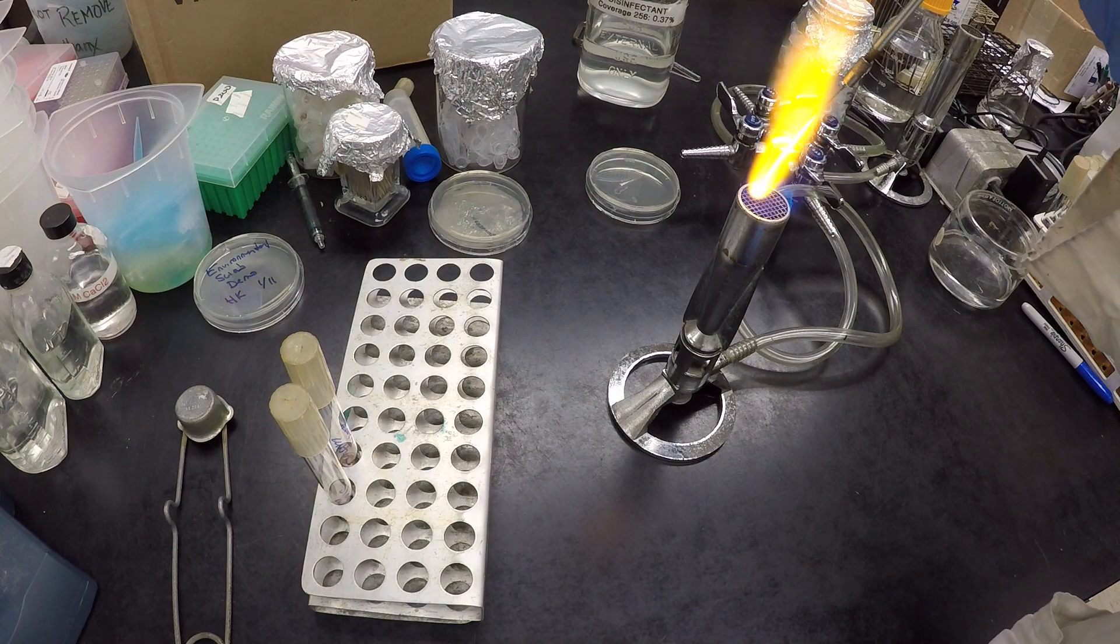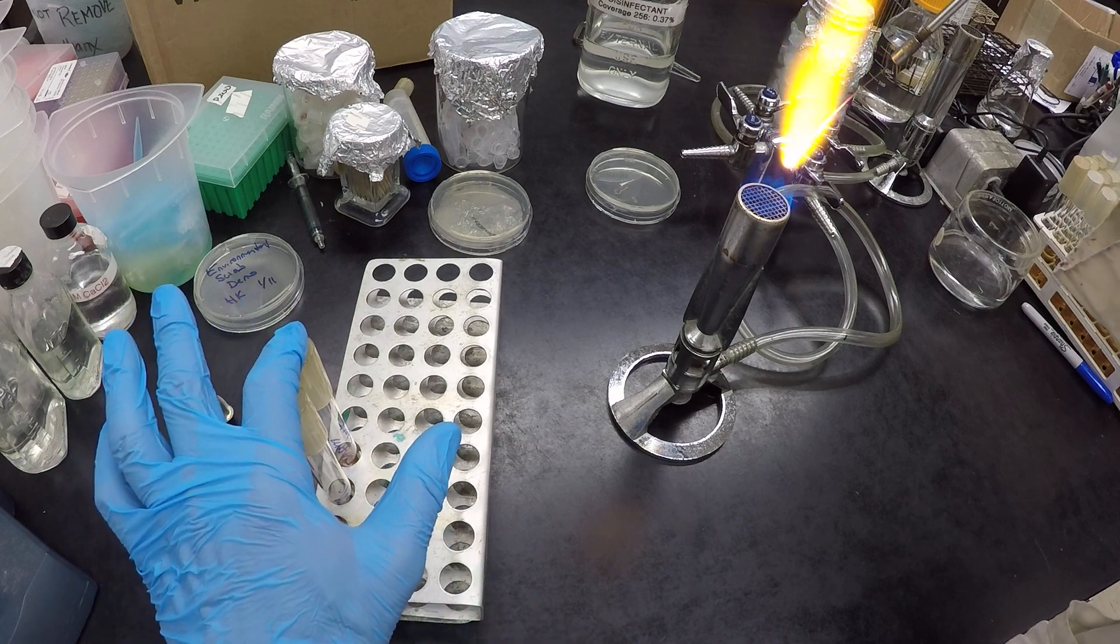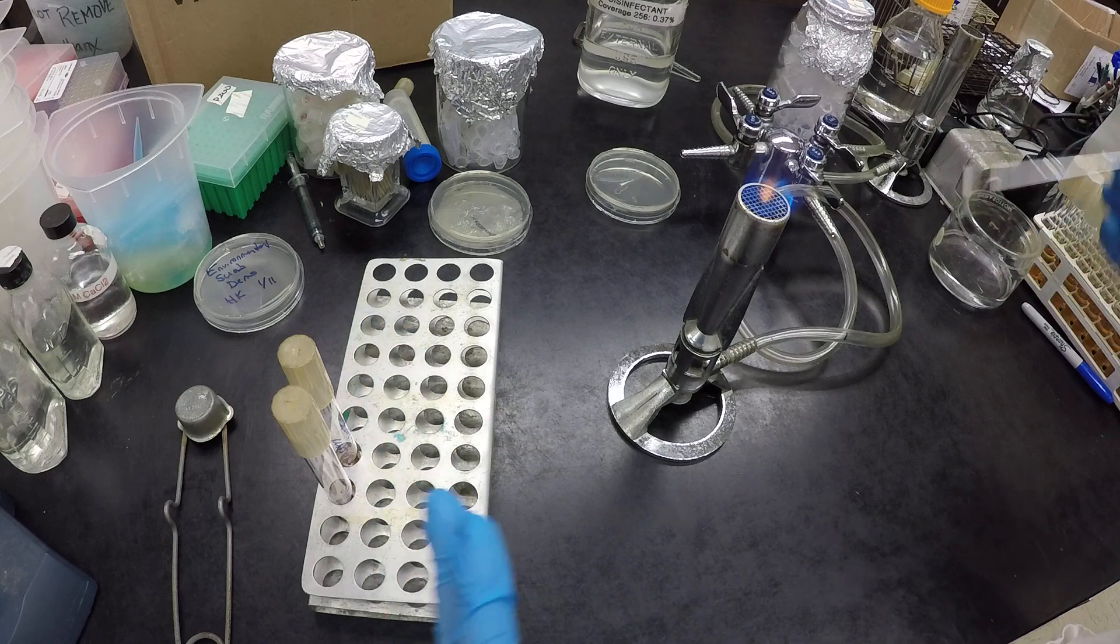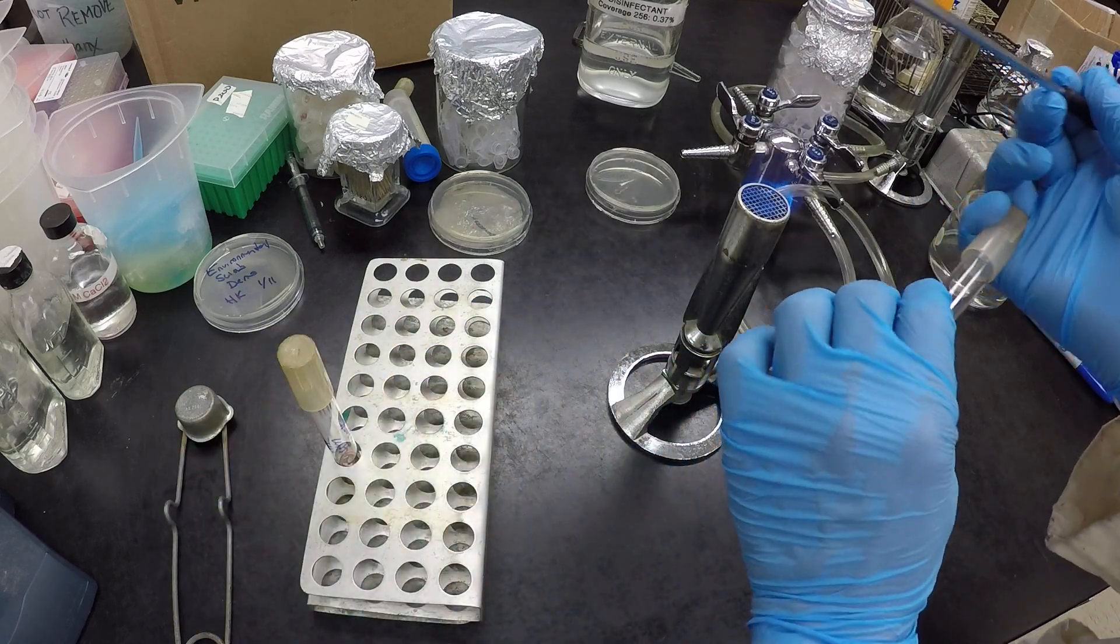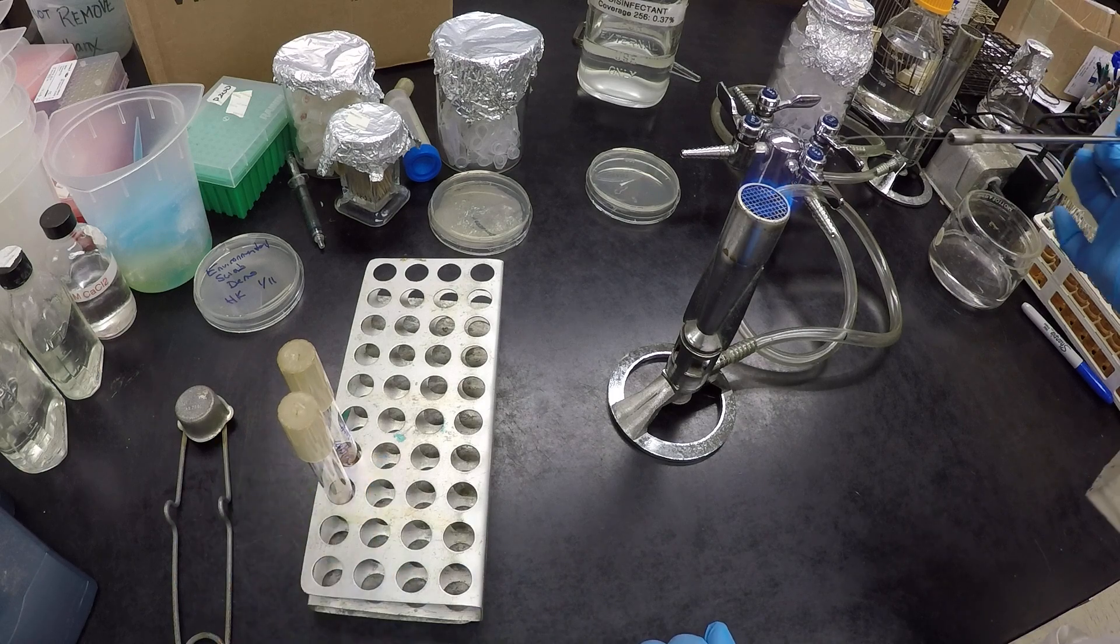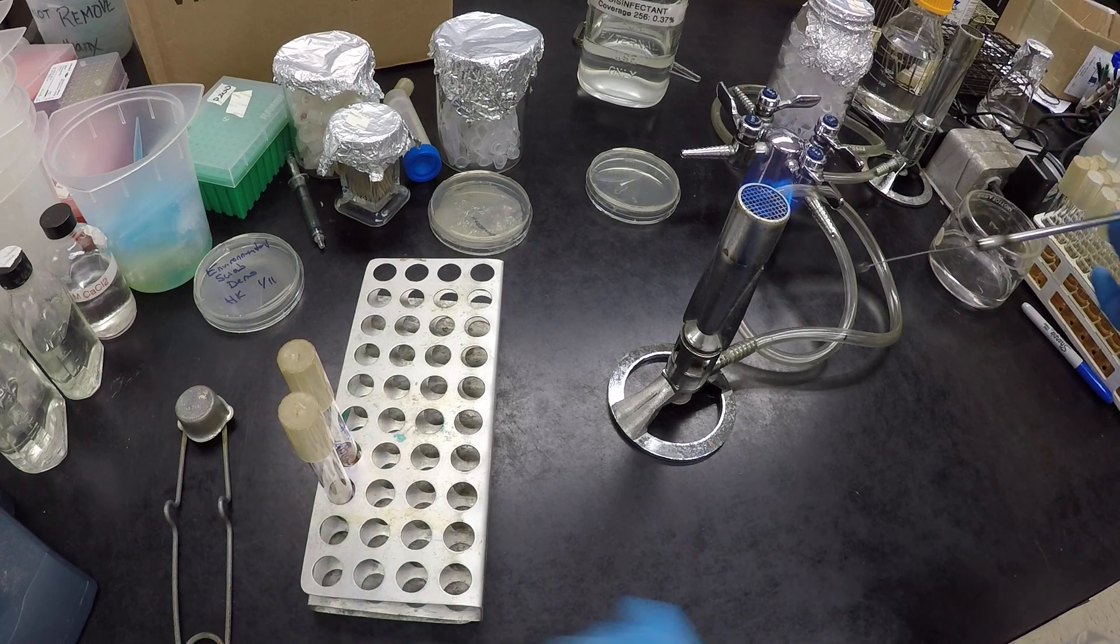That's how we inoculate a sterile broth and a sterile slant. Notice, by the way, everything was done near the flame, so whenever I open my tubes, I always open it near the flame.